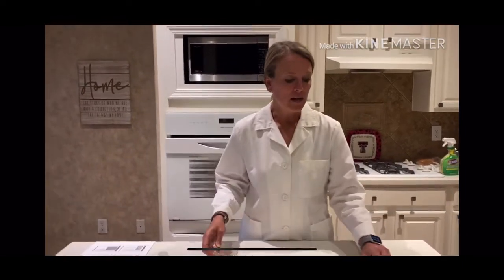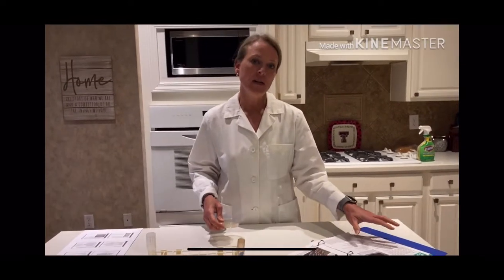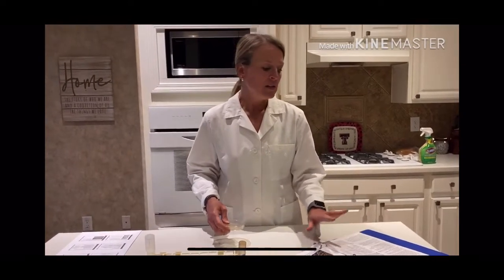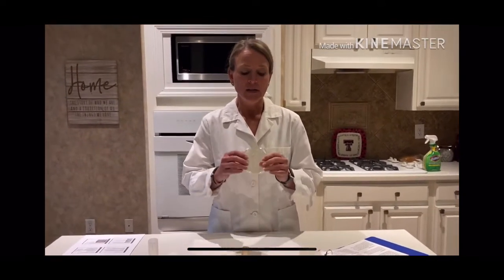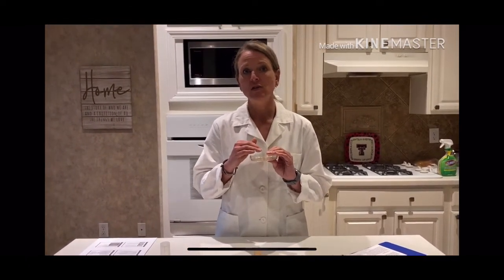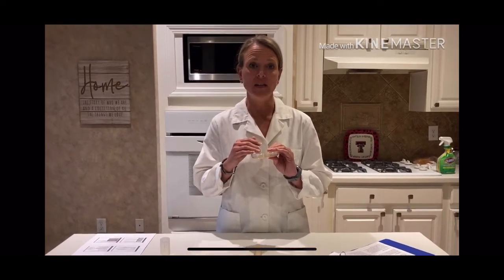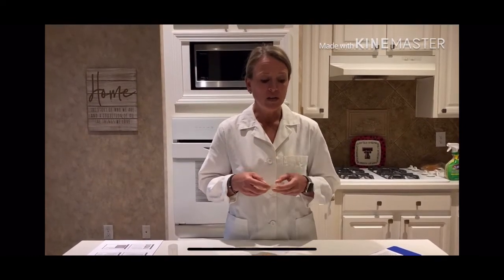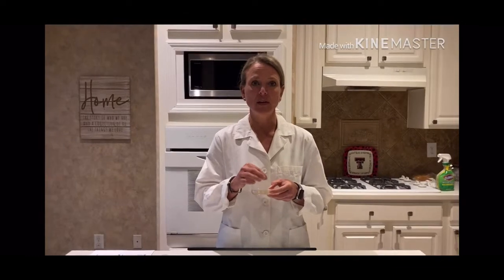Using your lab manual, you want to be able to describe using the terms that are designated in the lab manual. So we're going to start off with the colony morphology, or the growth of the colony on the plate. If you recall, when you're growing an organism on a plate, you're trying to streak for isolation, and you'll have individual colonies of bacteria on the plate. When we're describing the morphology of the organism, we're looking at the individual colony, which is going to appear as a little circular dot on your plate if you did this correctly.